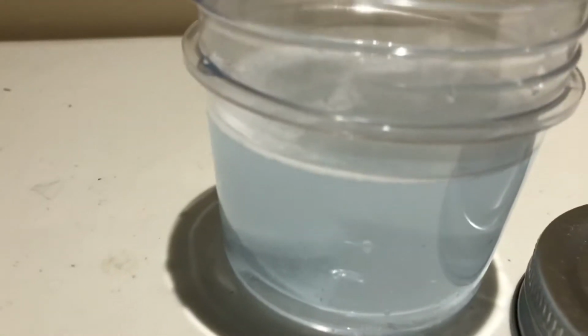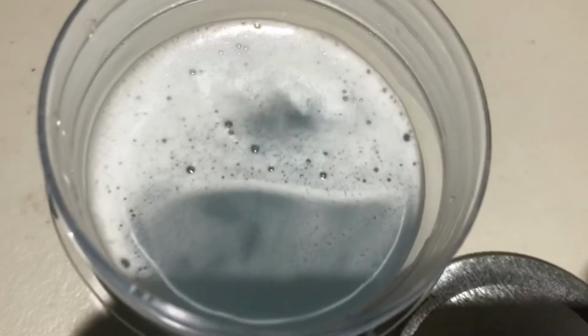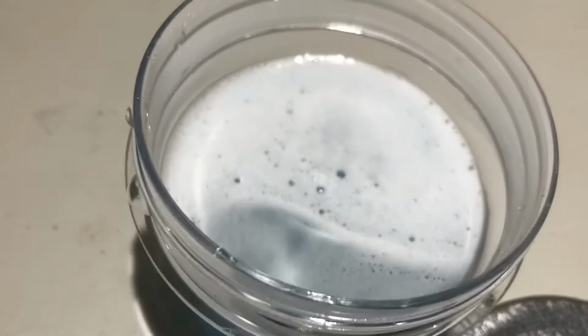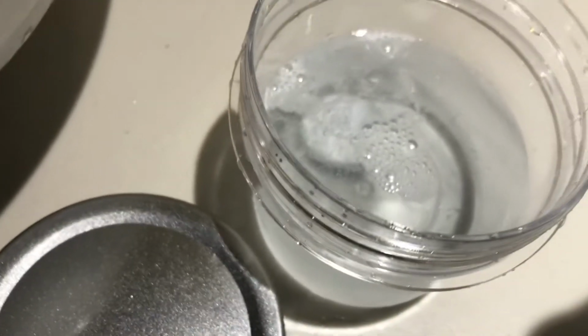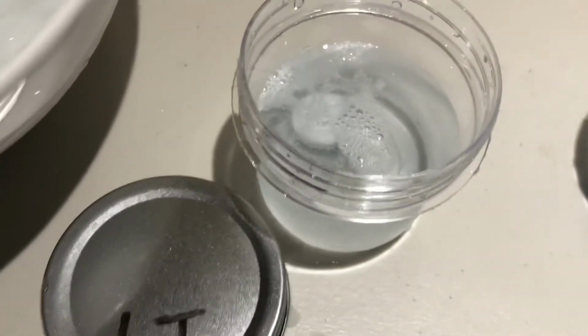If you notice, this one right here at higher temperature is bubbling a bit more than this one right here. So this one's bubbling also. The lower temperature one, LT, is bubbling, but not as rapidly as this one. You guys see that? This is the higher temperature, and this one is the lower temperature one, not bubbling as fast. So why did that happen?